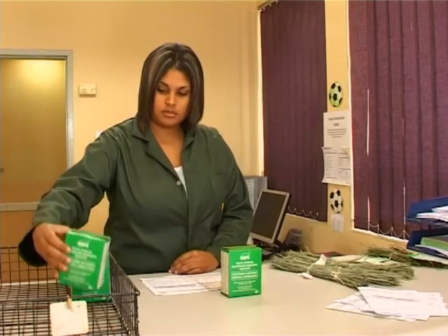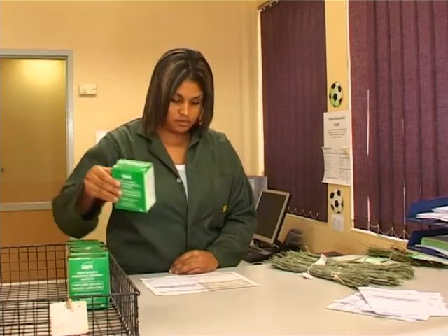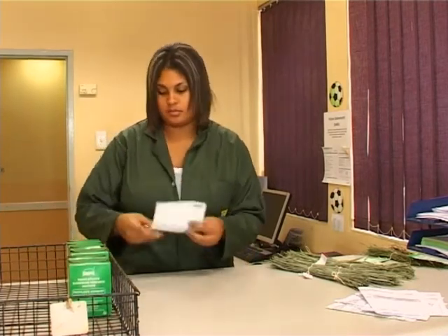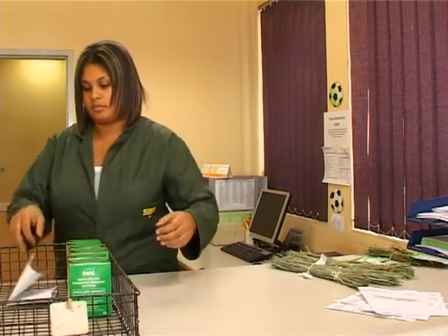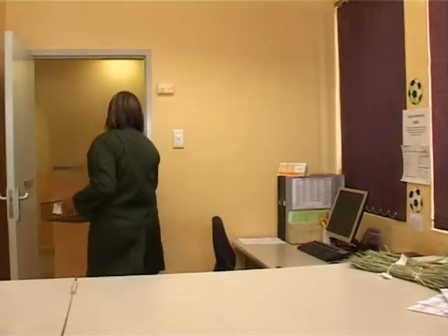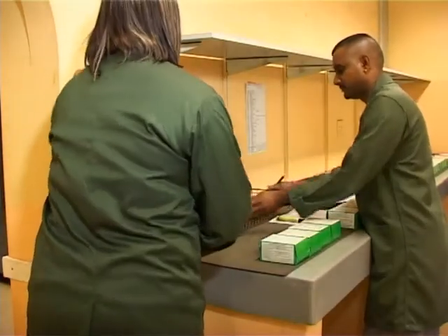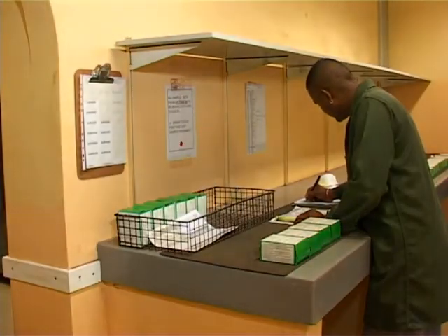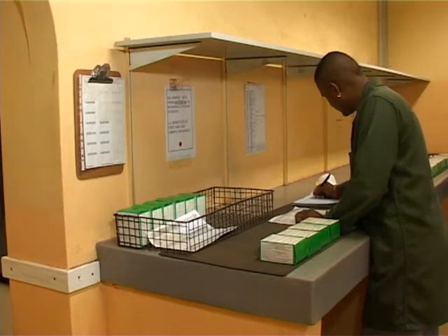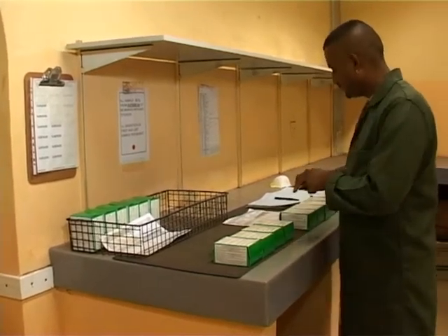Let's start by looking at the processing of soil samples. When samples arrive here in the reception area, the details are checked on the submission forms and boxes. Samples are then taken through to the registration room, where your samples receive unique FAS sample numbers. These numbers are used to track your samples as they move through the different stages in the laboratory.